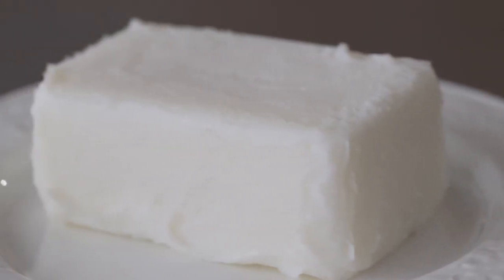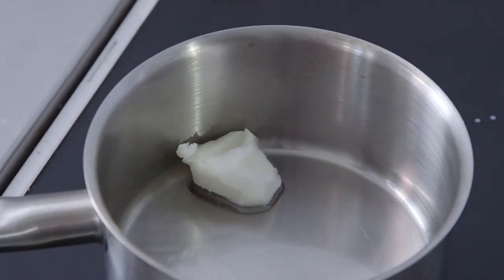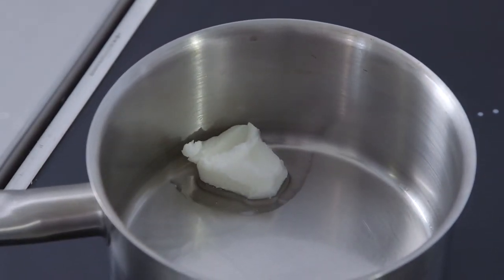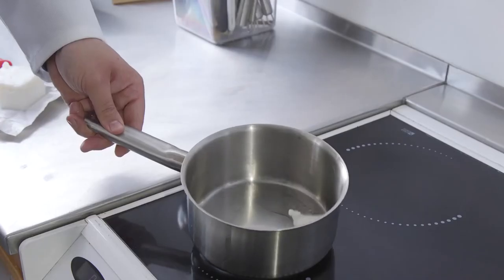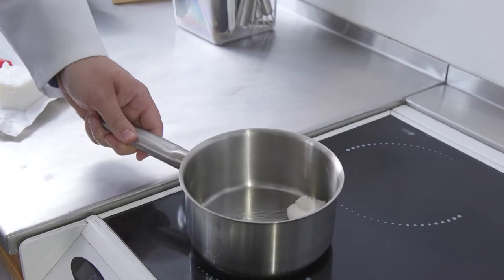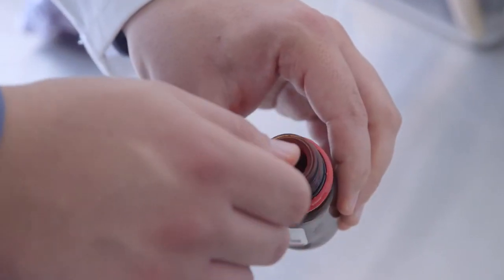That is what the first experiment is going to investigate. We are using lard in this experiment. Along with many other commercial fats and oils, it contains antioxidants to increase its shelf life. If you want the reaction to proceed faster, you can use fat which can be collected from cooking bacon, sausages or even oily fish. To visualize the process, we mix beta-carotene in with the fat.